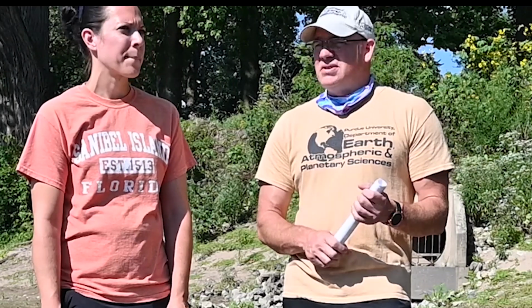Is there any other tests that we have? We talked about temperature, dissolved oxygen, pH, nitrates, phosphates. Is something else we can test? I think that's kind of all of our tests, isn't it? That's what we have. And yeah, there's more tests that different people could take. They'll do flow rates and depths and all of those. But those just aren't tests that we're doing today. We're kind of doing what we consider more chemical tests to a degree, but I'm not sure if that's the right word really. But these are the tests that we've picked for overall indicator of water quality health.